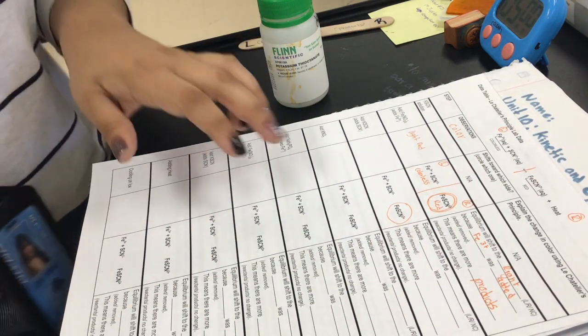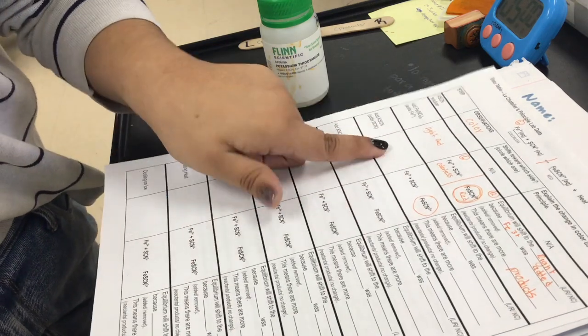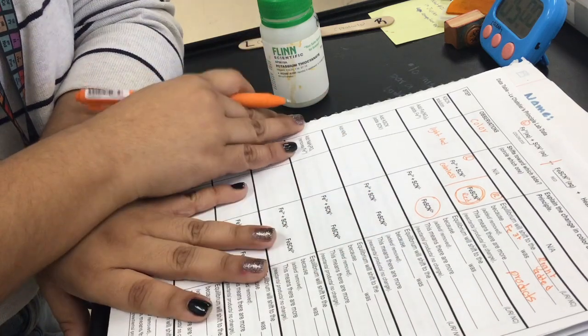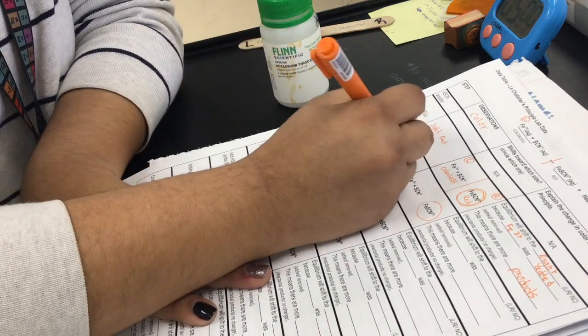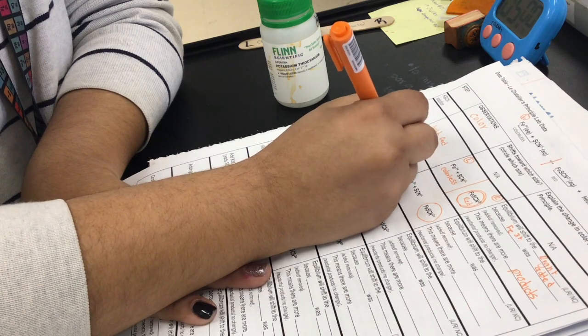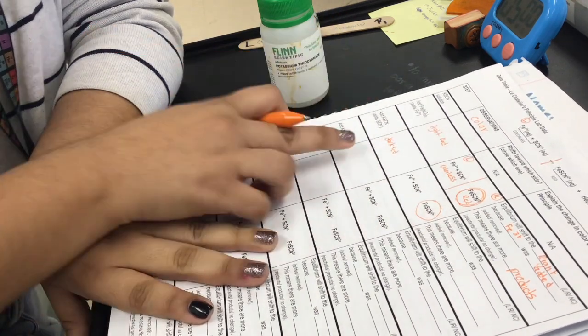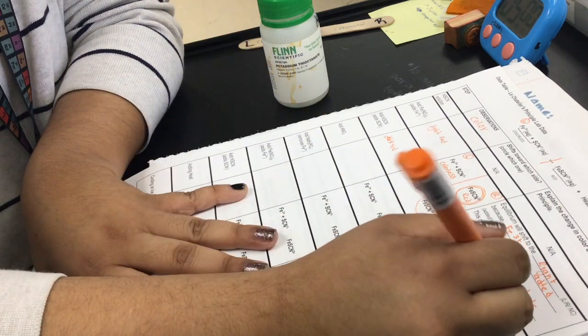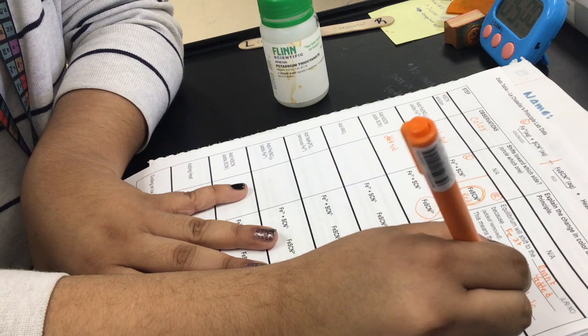Okay, so let's go ahead and do the same thing for this one. If it's no change, you write just no change for the lines. But I remember this one was like darker red. Dark red. Okay, so it means that the equilibrium shifts to the right again because red is on the right.